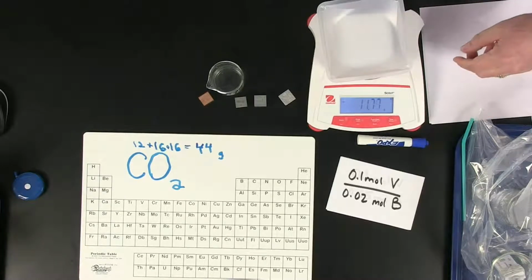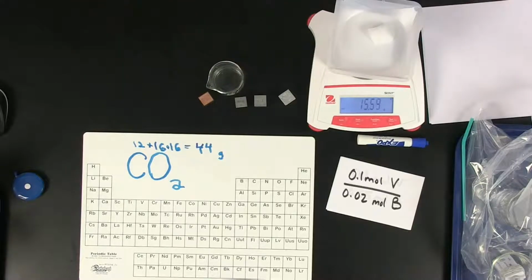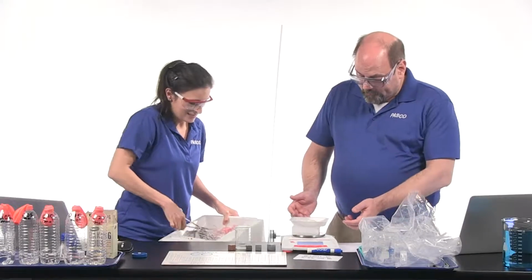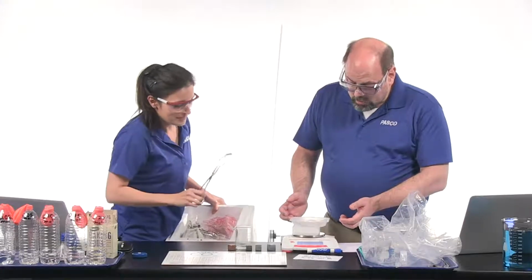Okay, we've got the balance on. Let me tare that and take off the mass. You ready? Yep. Whoops. That's all right. No, you're doing good. You're about 15 grams there. Okay. How about a little more? Yep, we're going to 44. Another chunk. Awesome. 38, a little bit more. Yep, just a little more. This is a little. Oh, that's perfect.